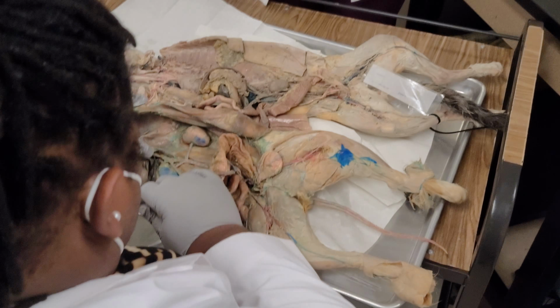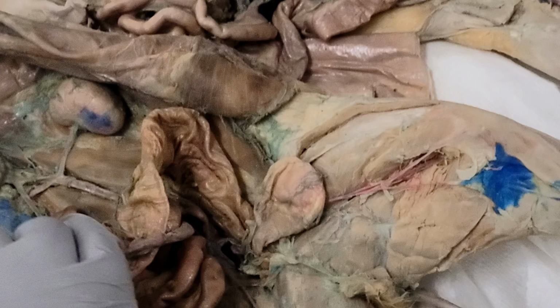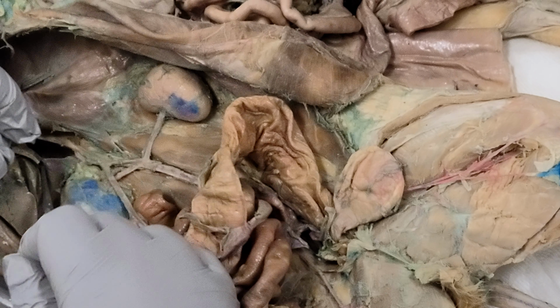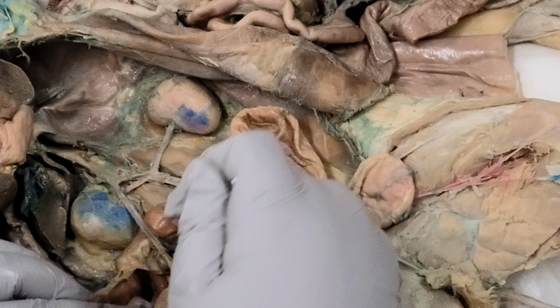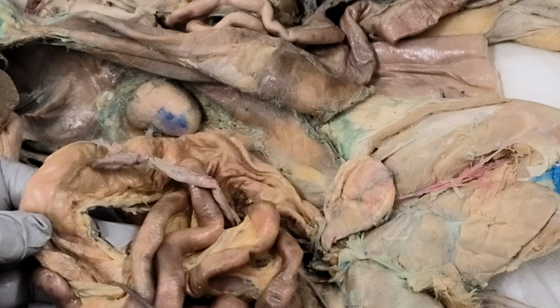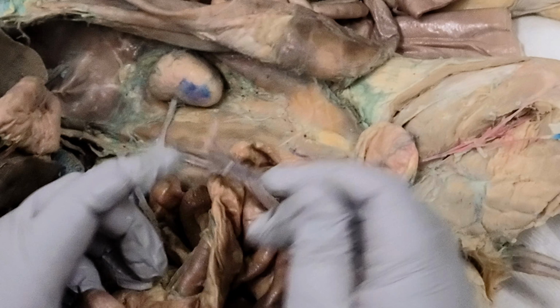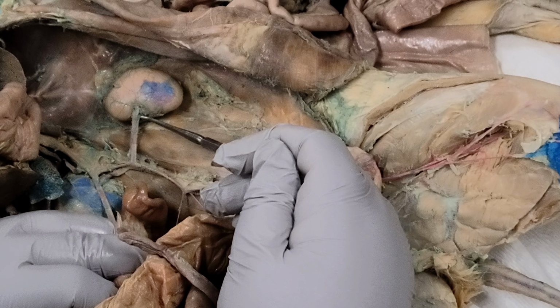All right. So the abdominal aorta, you just follow the aorta all the way down. Okay. So it's the center artery. This would be the celiac trunk, but obviously it's been cut off. But it's the first branch. The second branch goes into the mesentery proper. Okay, so it's called the superior mesenteric artery. The artery that leads into the kidney, we call this the renal.